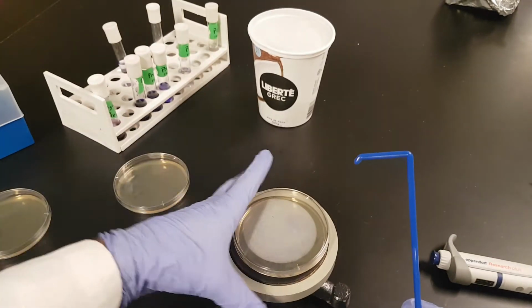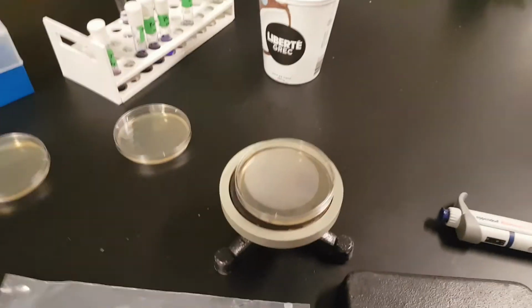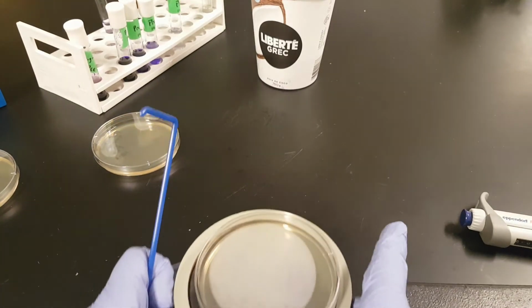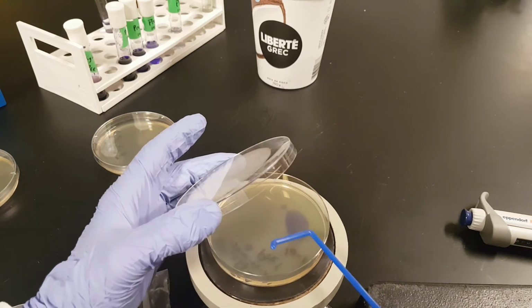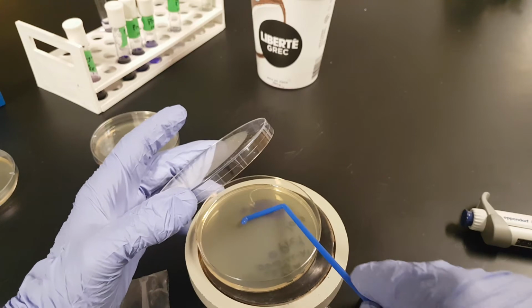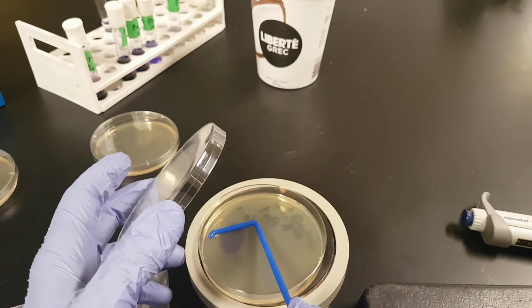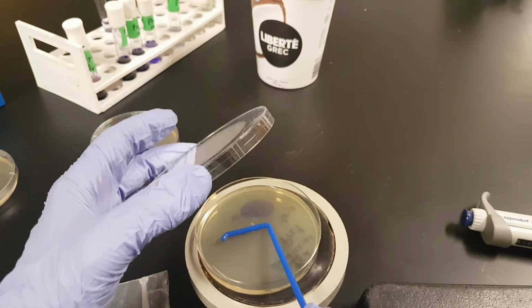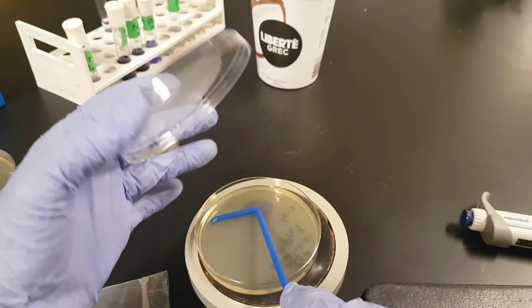Okay, so, let's go ahead and tilt this down, and I'm actually going to lower the camera a little bit. Bring this a little bit closer, not that close. All right, so you can see we have our plate here. You can see the sample is there, and it is not dried out, but it has stained the surface because we're talking about crystal violet here. That's sort of an illustration of if you take too long, your sample will just end up in one place, not spread out. You won't end up with a spread plate. You won't be able to count it properly.